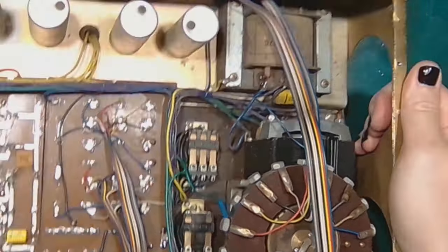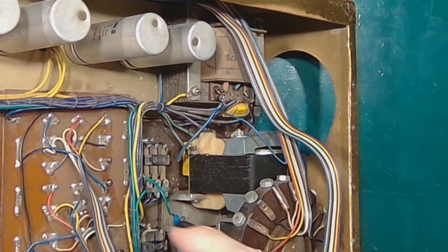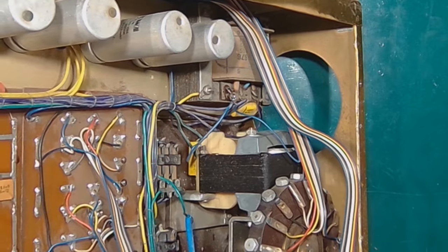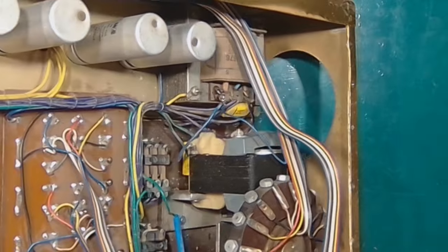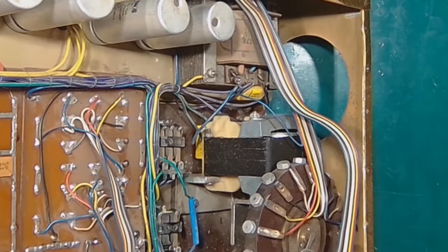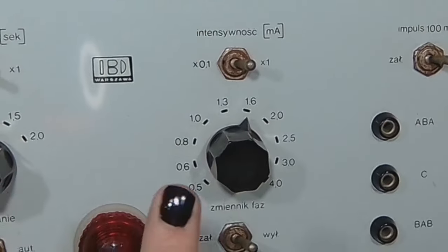And this board is basically a resistive voltage divider. It's a switchable resistor ladder that decides the shock current.